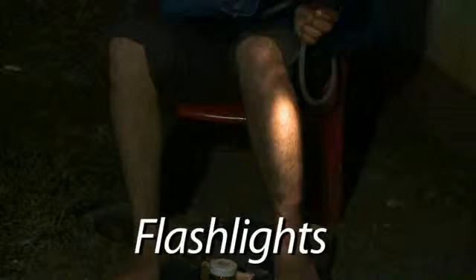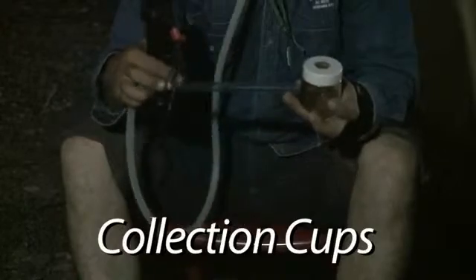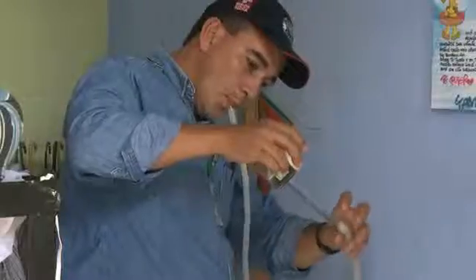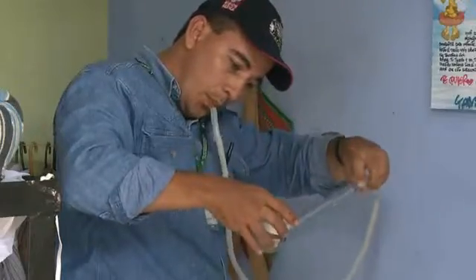Mosquito collection can occur during the day or at night. If planning to collect mosquitoes in the evening, make sure to have a flashlight to assist in finding mosquitoes. Cups made of unwaxed paper, plastic, or styrofoam are suitable containers for holding and transporting live mosquitoes.